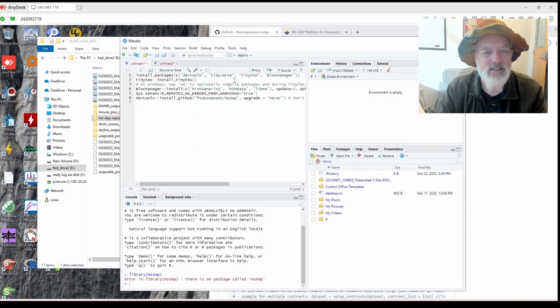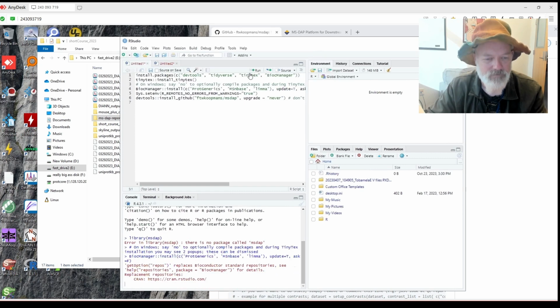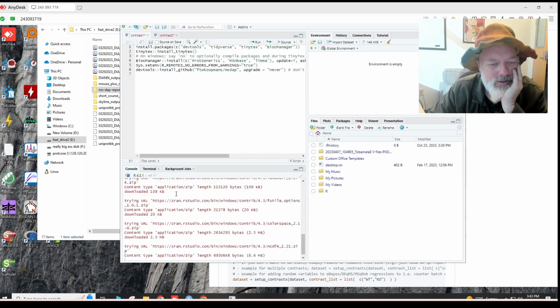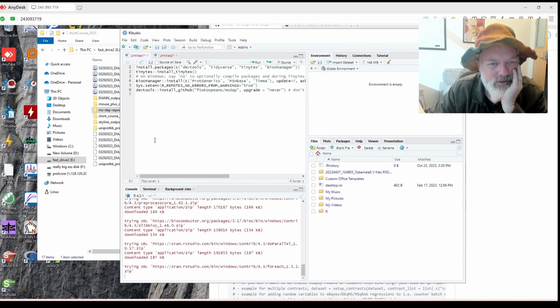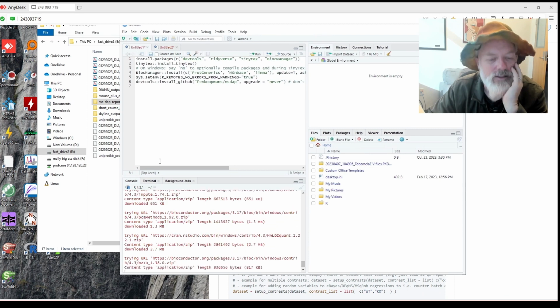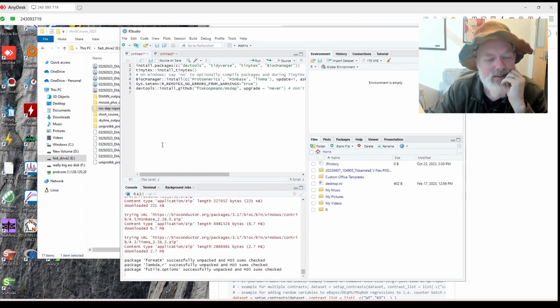Oh, well, let's see. We installed DevTools, Tiny. Let's try this one and install BioC Manager. Okay. Let's see. So now it's going to install a lot of other things. Let's try that. So hopefully you only have to do this once.